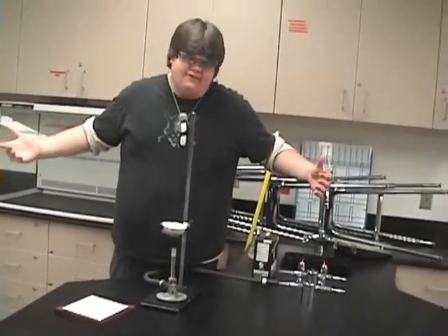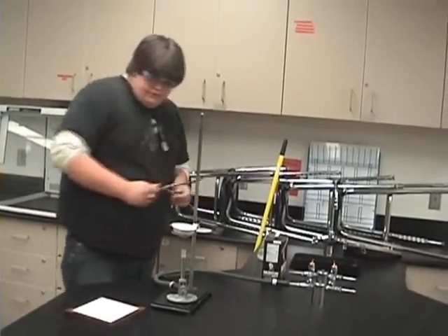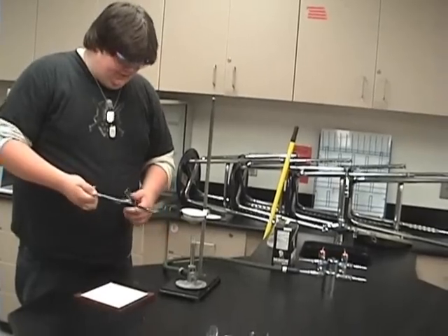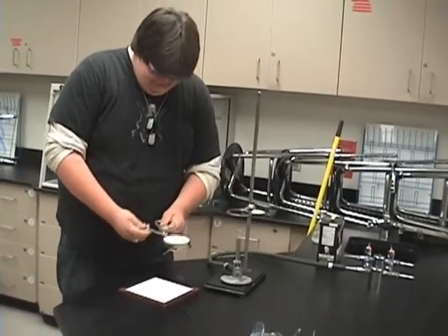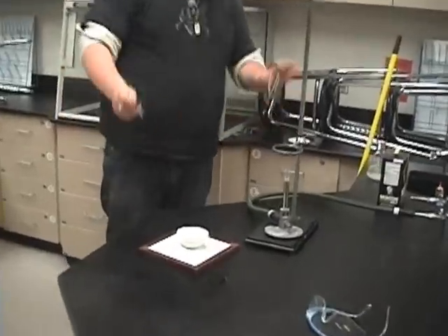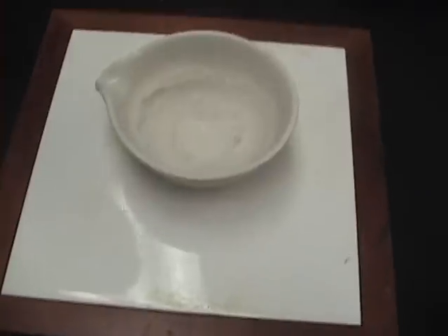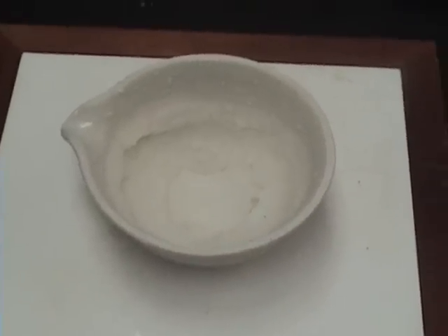We have, in fact, turned off the fire. Now place it on this here tile — trivet. As you see, we have salt. It is salt — the water has evaporated. It is salt.